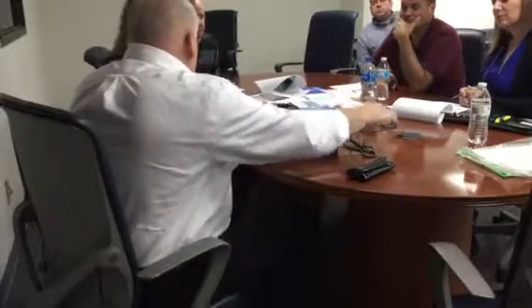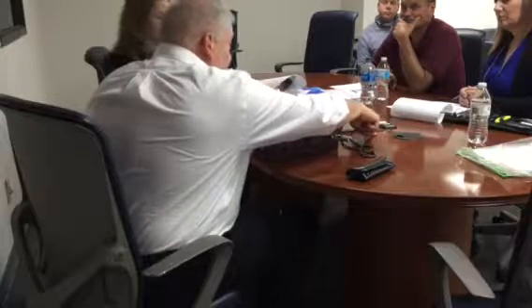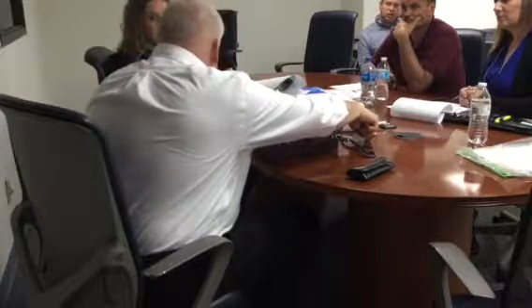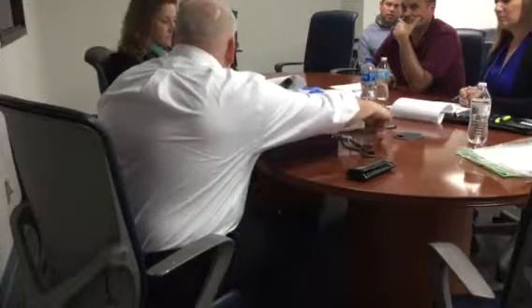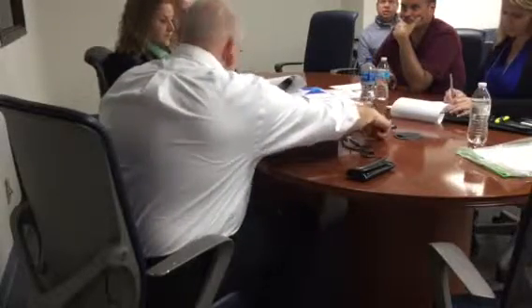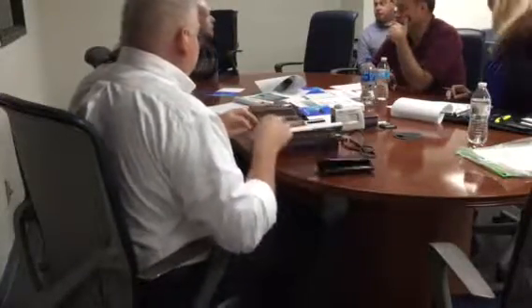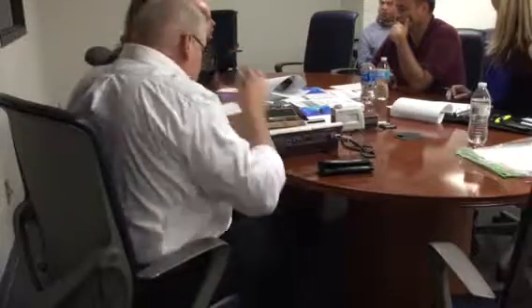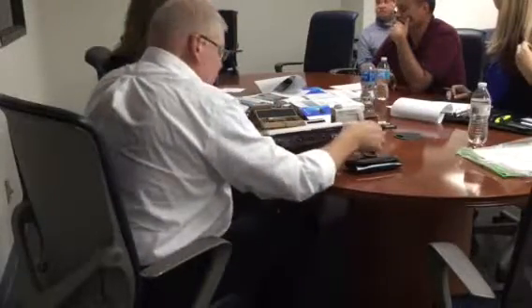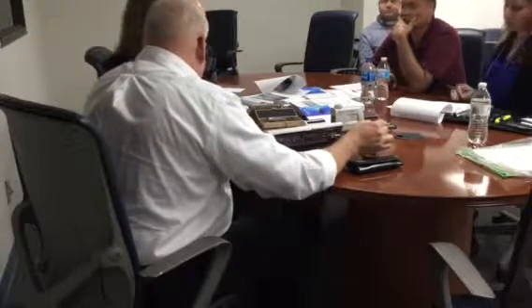This is the most important, because somebody you're measuring these things for is going to say, no, you're wrong. And you have to come here and be able to prove that you're not wrong. That's how you prove that the equipment's working, with this specimen. It's got a known value. When you take a trace and it displays that known value, that's the proof that the instrument's working properly. We should get a 2.97. We take a trace, we get 2.9675, and so we know the unit's working properly.